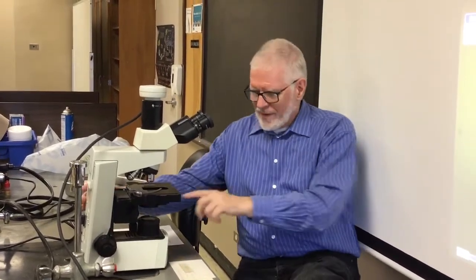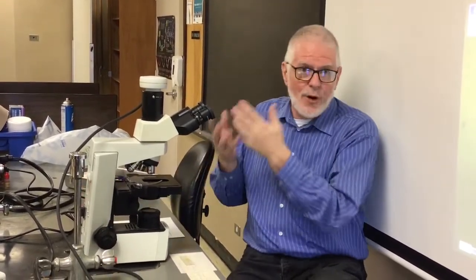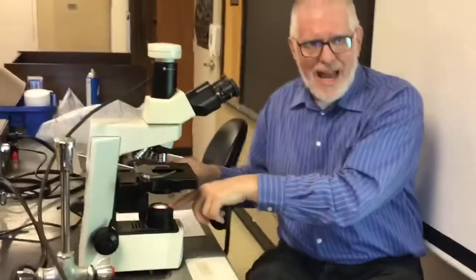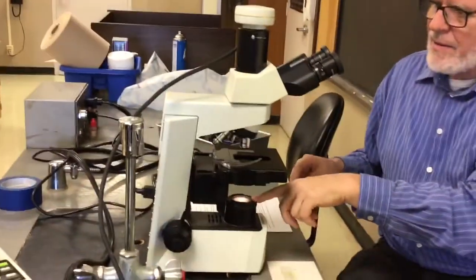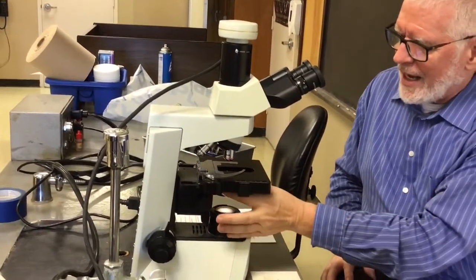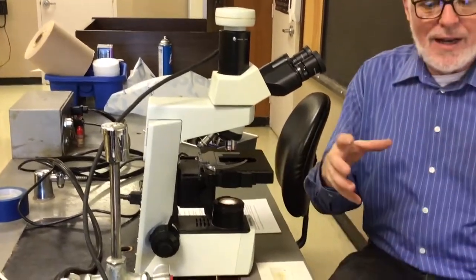So every scope, this is a transmission light microscope. It sends light through what you're looking at. And so when you look through the scope, you get a bright background. So I'm going to turn the light on. Light comes on down here. Up here is a lens. The lens takes the beam and tightens it, pulls it tight on what you're looking at.